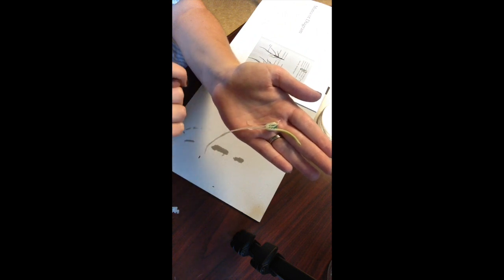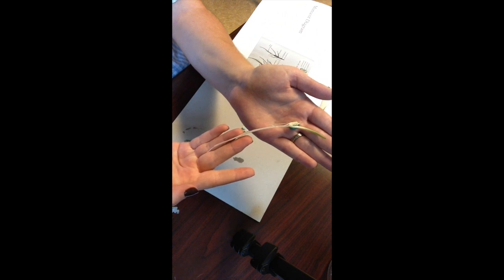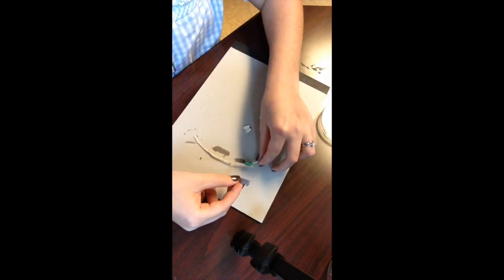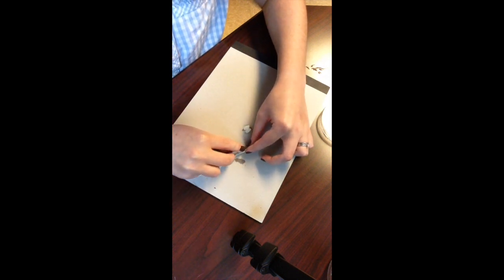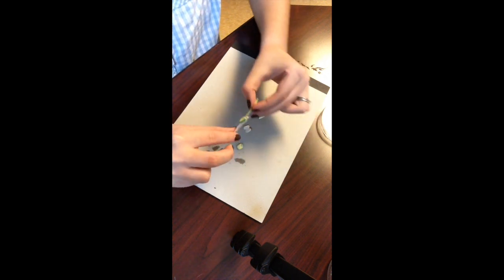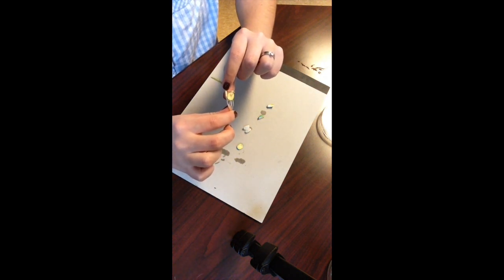The next that I'm going to be pointing out is going to be the primary root and secondary roots that are emerging. I'm also taking the razor blade to cut this kernel in half. What I want to see is the cotyledon. If you look closely, you can see that little dark spot, and that's going to be the cotyledon.